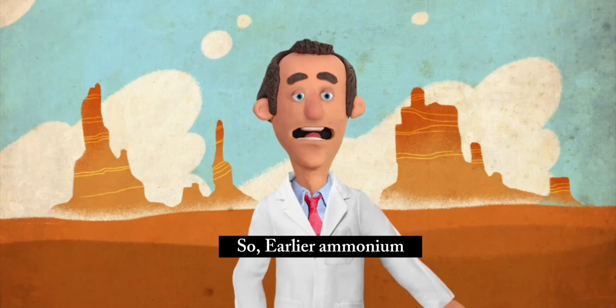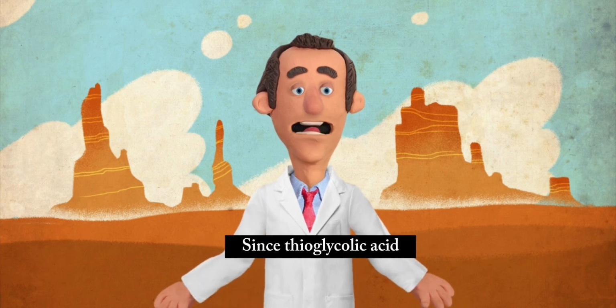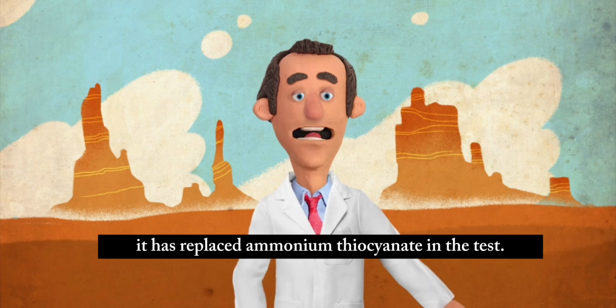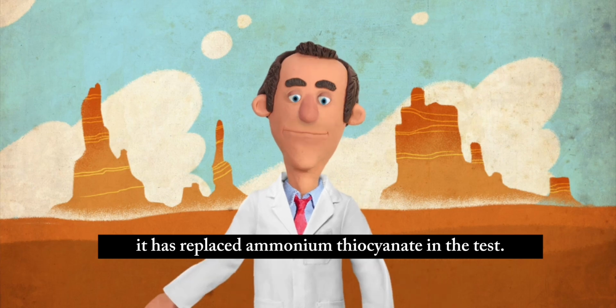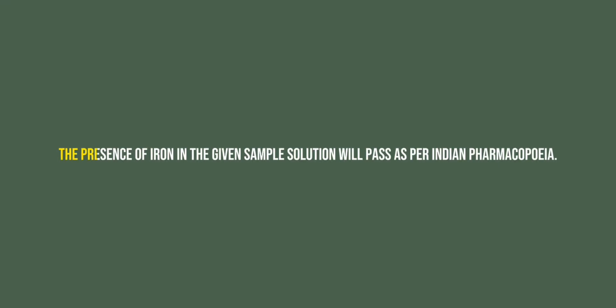Earlier, ammonium thiocyanate reagent was used for the limit test of iron. Since thioglycolic acid is a more sensitive reagent, it has replaced ammonium thiocyanate in the test. Observation: the purple color produced in the sample solution should not be greater than that of the standard solution. If the purple color produced in the sample solution is less than the standard solution, the sample will pass the limit test of iron, and vice versa. Inference: the iron in the given sample solution will pass as per the Indian Pharmacopoeia.